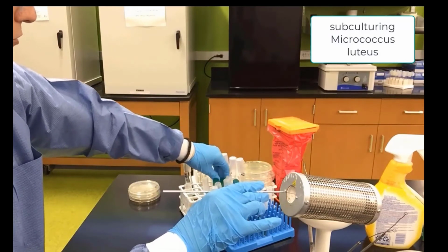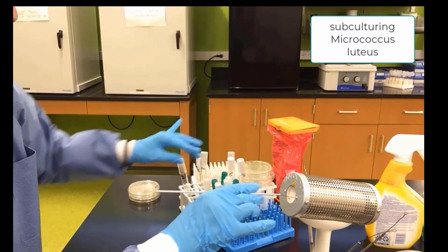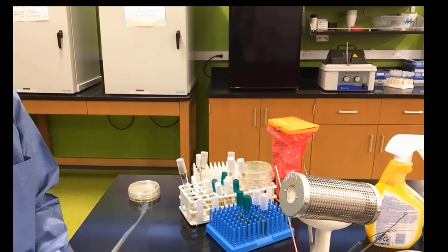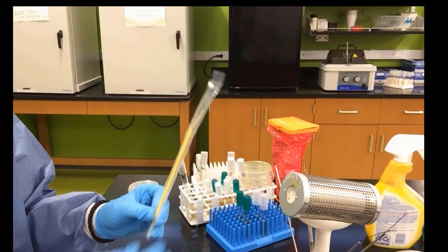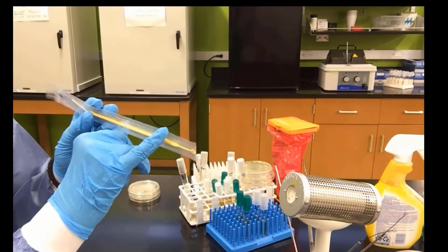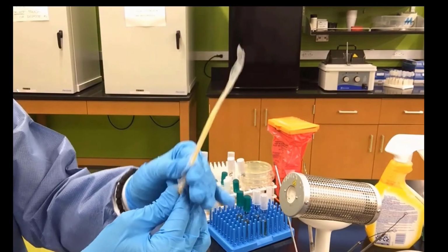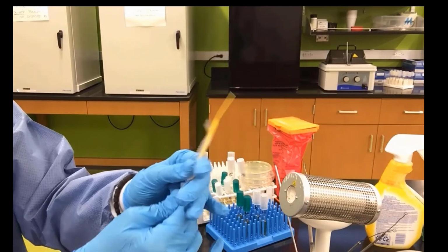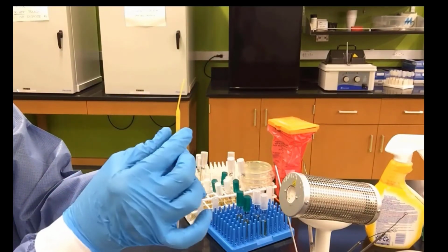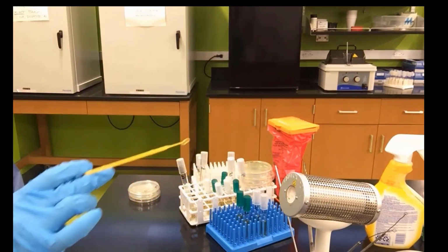We organize our materials to make space for the other two bacteria that we have to subculture. Now we will move on to a different method. We will use, instead of the metal loops, these disposable loops. You can see a loop on one end and a needle on the other end. They come in little plastic bags. They are sterile. And we push the needle end out. We never touch the needle or the loop side.